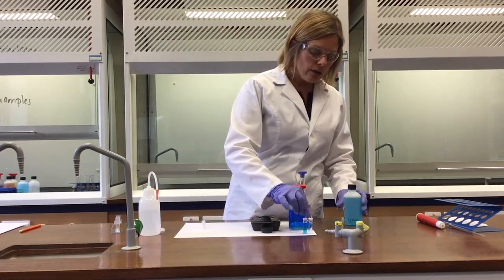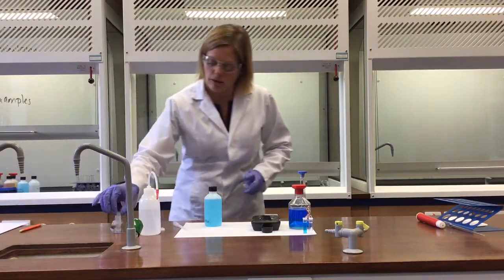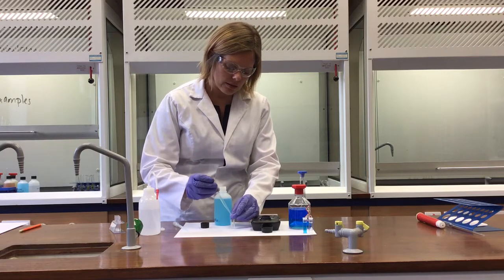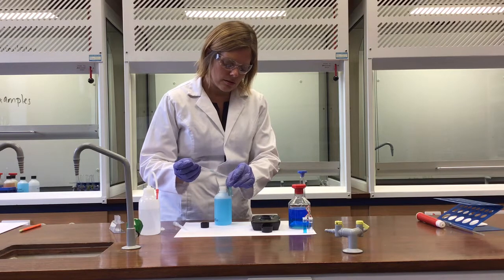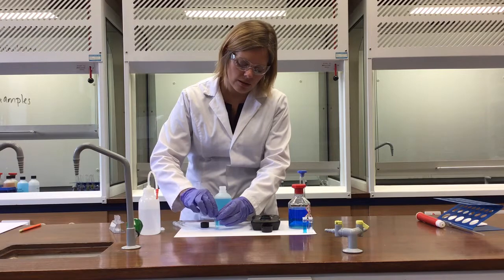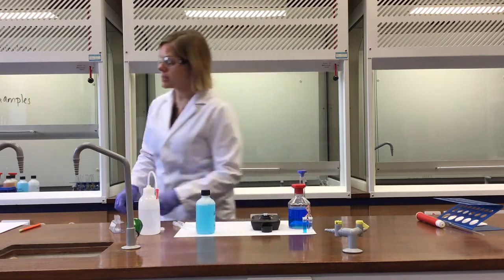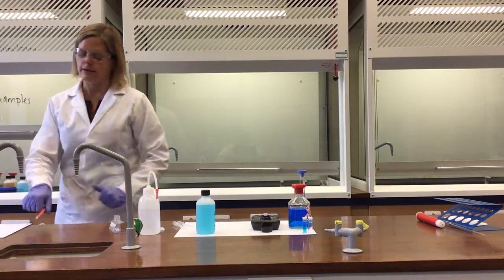Whilst I'm here just now, why not do the unknown concentration one as well? I'll take that unknown concentration, I'll take this pipette just to add that into here. So whatever that unknown concentration is, I can measure that it gives an absorbance reading of 0.28 on this scale, so the unknown is 0.28.